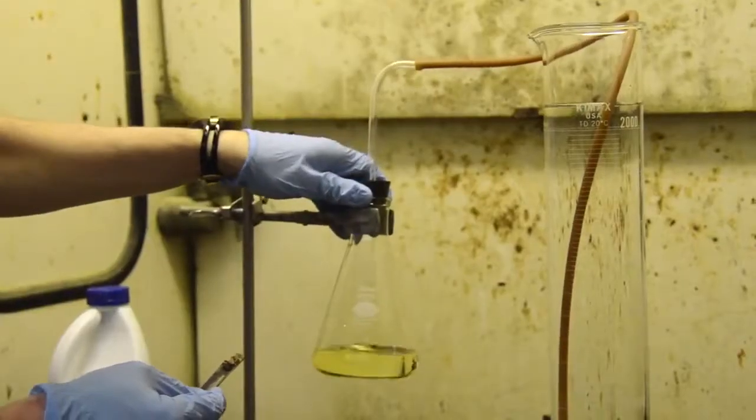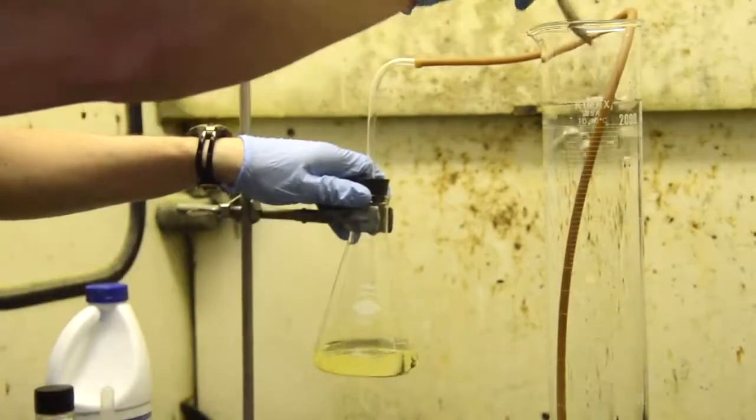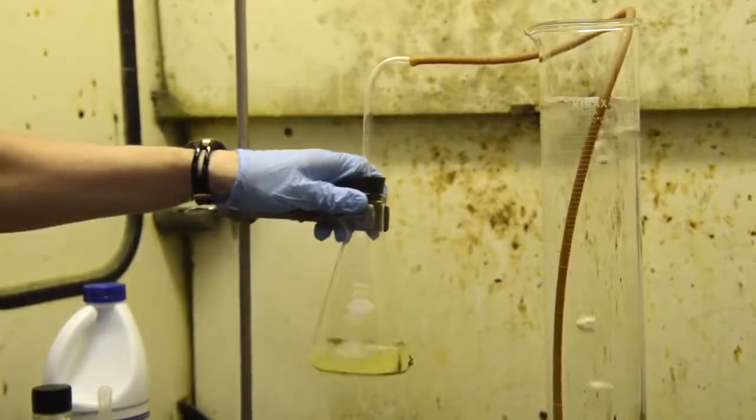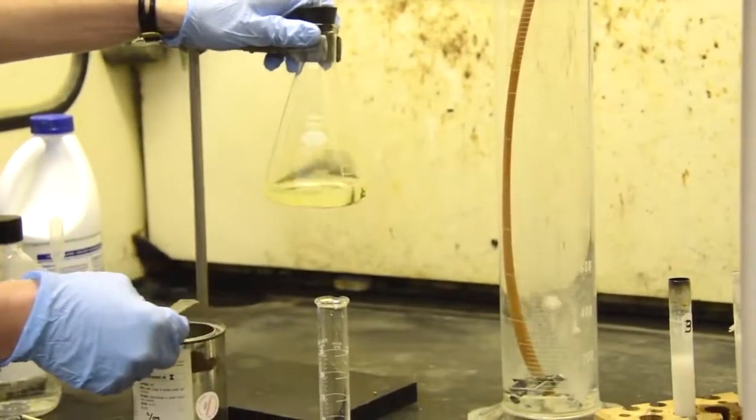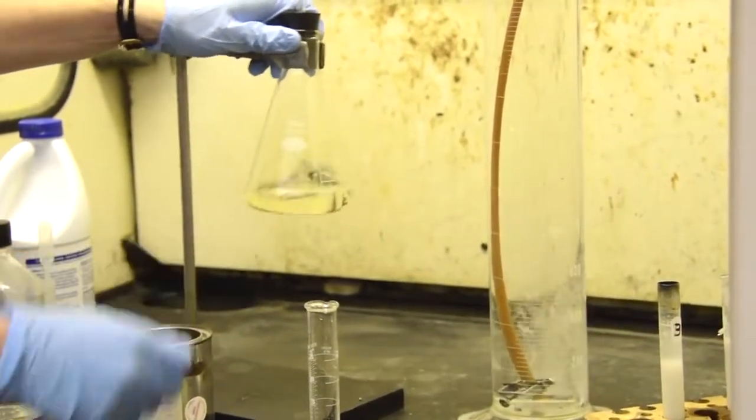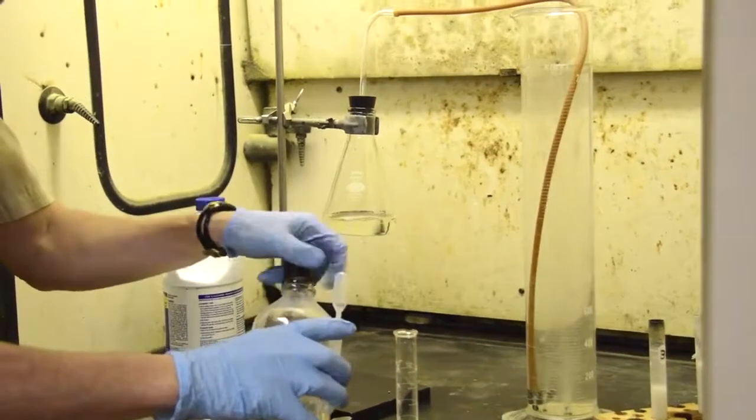Add the calcium carbide, which is going to make the acetylene. I think I should probably go for it right now. Once that becomes more chlorine, we'll start to see some flashes of light. That's the energy that's produced. I'm going to put some more acid in. Those were famous last words, I'm sure.